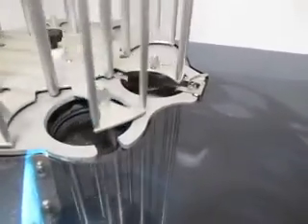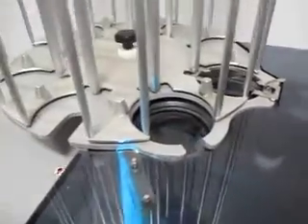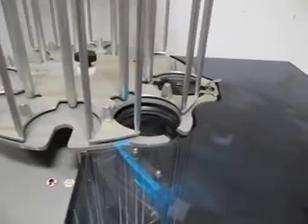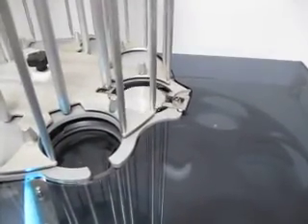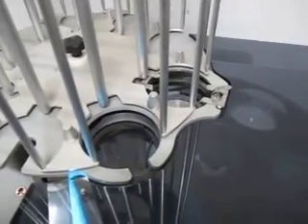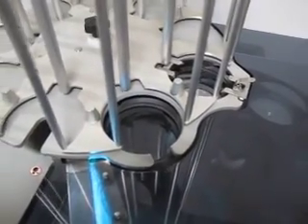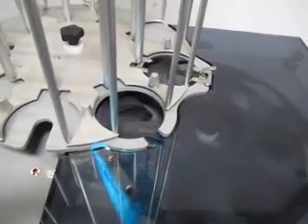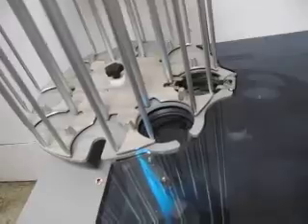I don't know what's happening or if I pressed enough buttons. I don't know if this means anything or not, what I'm taking pictures of — but it appears to function. I don't know what else it's supposed to do; I don't see it pouring anything, but maybe that's what it is.